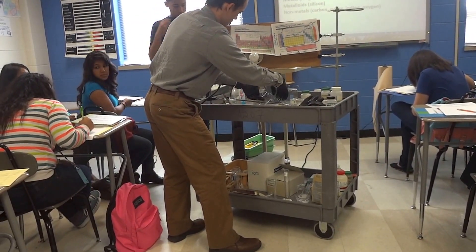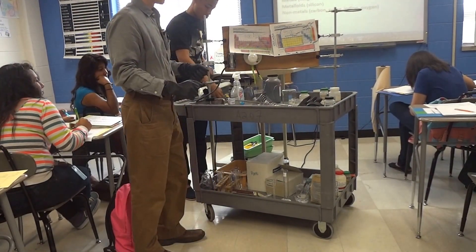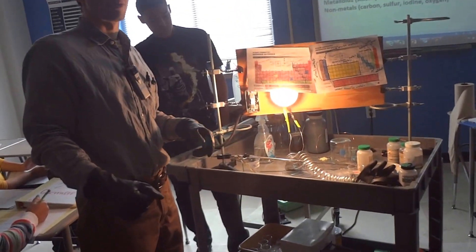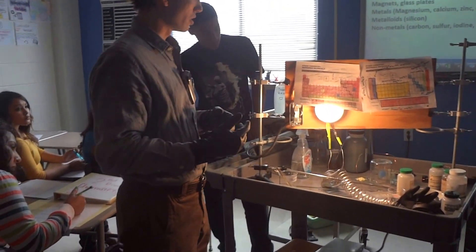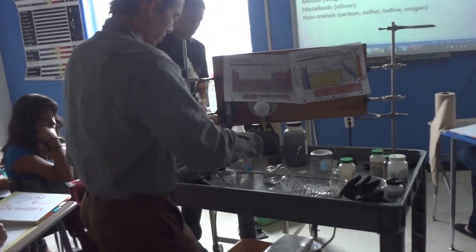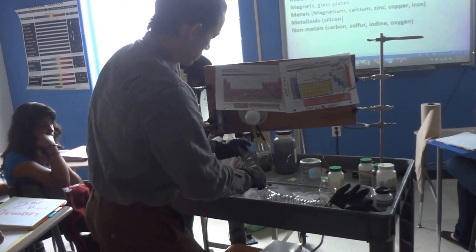I have the magnesium in contact with the two leads. You'll notice it's a very strong conductor — magnesium is definitely a conductor even though it's not iron. Go ahead and turn that off, and record that information in your data table.